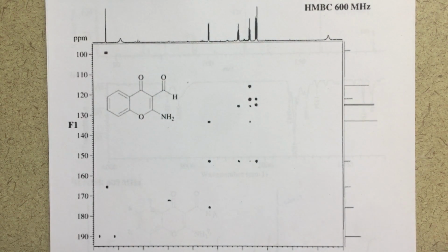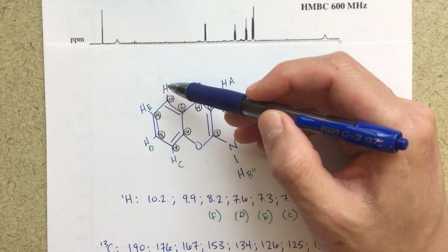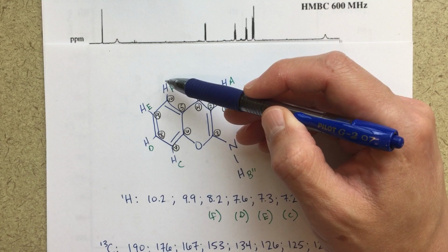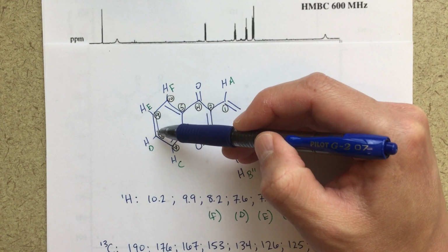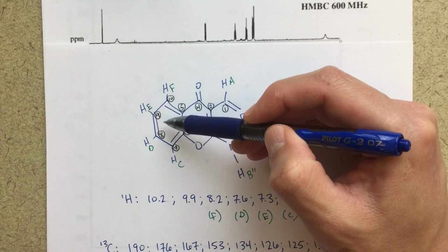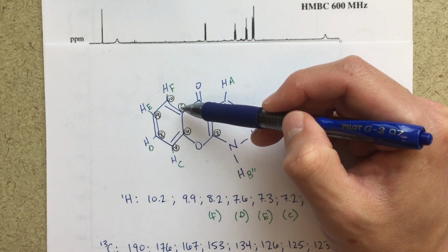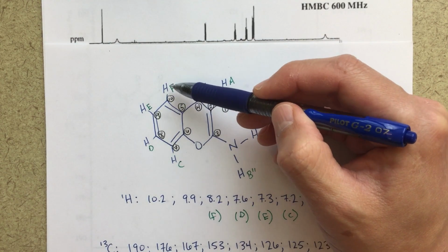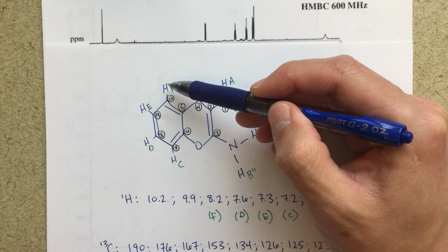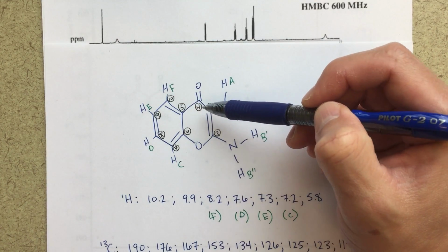So the HMBC is a multiple bond correlation. So the way that this is going to work, if we bring this back in here, for instance, from this proton here, it's going to be a multiple bond correlation between a proton and a carbon. So this would be 1 bond, 2 bonds, 3 bonds. So this proton here, we should see a correlation with this carbon, number 8. I would also see 1 bond, 2 bond, 3 bond, a correlation with this carbon here. So from HF to carbon number 6, and then from HF, 1 bond, 2 bond, 3 bond to carbon number 4. So HF to carbon number 4.